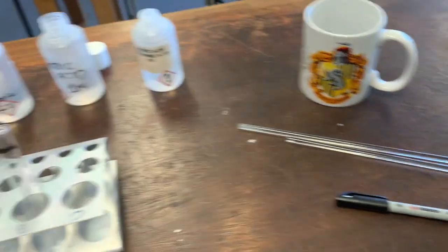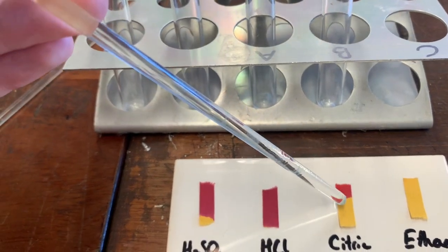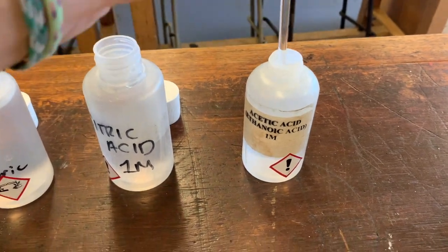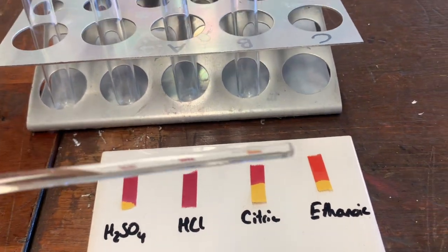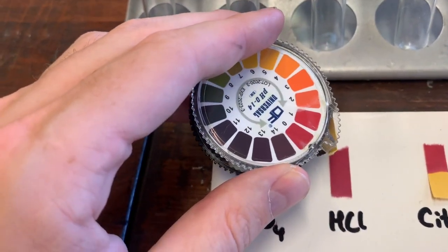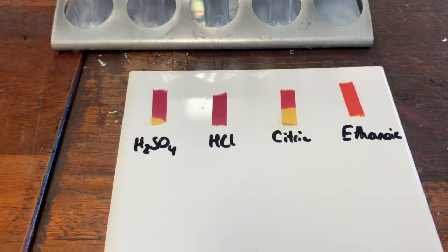Put this glass rod to one side. Now do it again for the citric acid, and finally with the ethanoic acid. Let's test these against the pH scale — hopefully you can decide what pH each of these is. Make your decisions now.